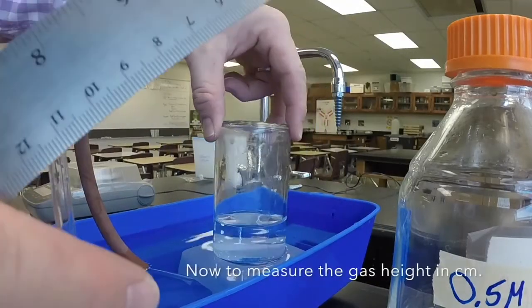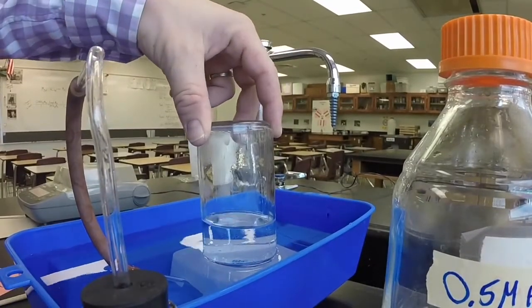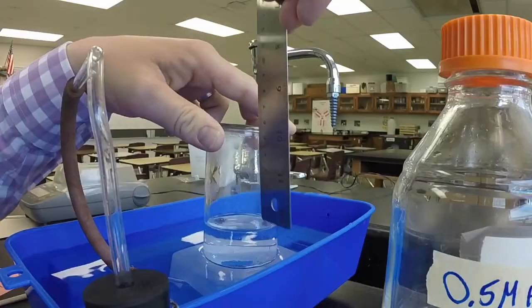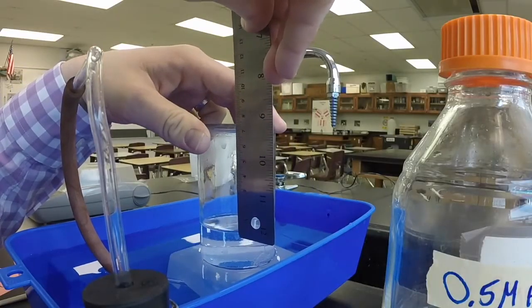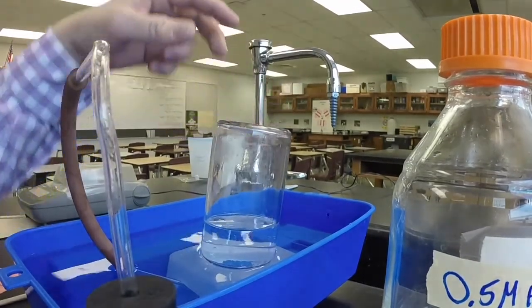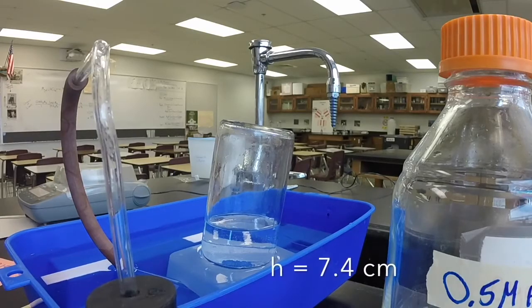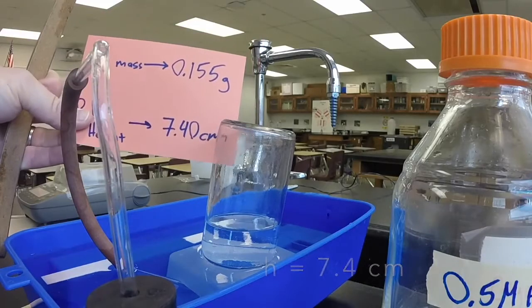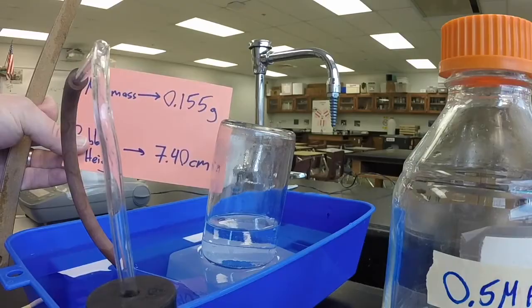Produced in the reaction. So I'm going to measure this, and I'm going to measure the approximate height of the bubbles in centimeters. Let me get down here at eye level, and it looks like we have about 7.4 centimeters. So the bubble height is 7.40 centimeters. There you go. So we'll use that in just a moment to calculate the volume of the bubbles.